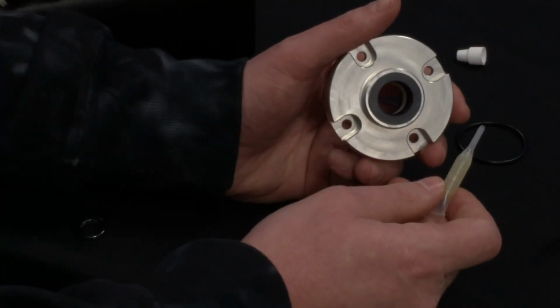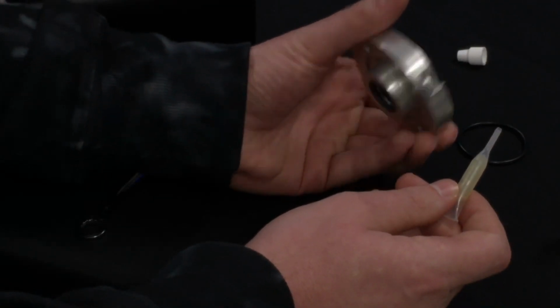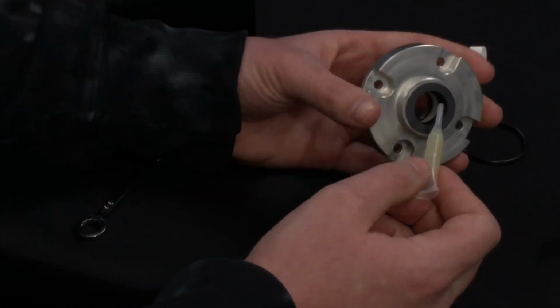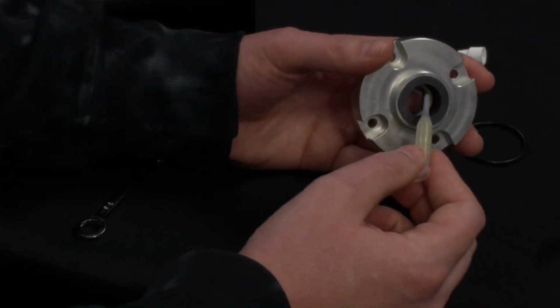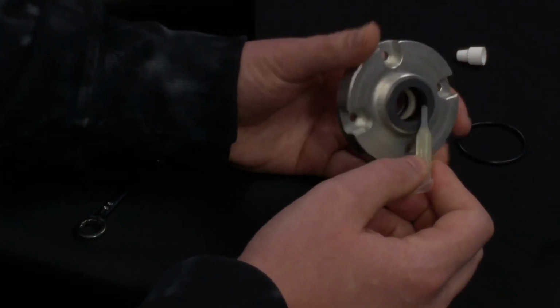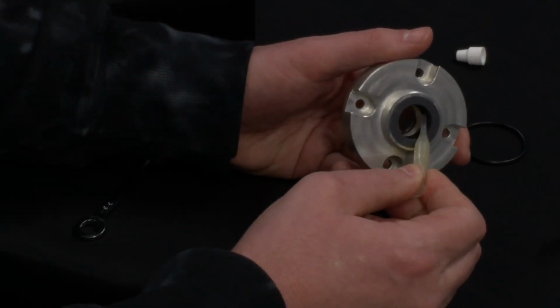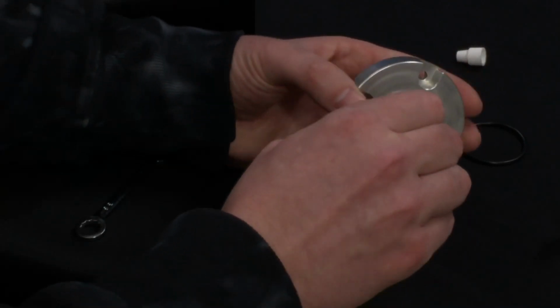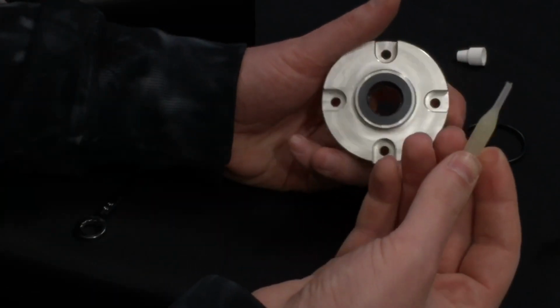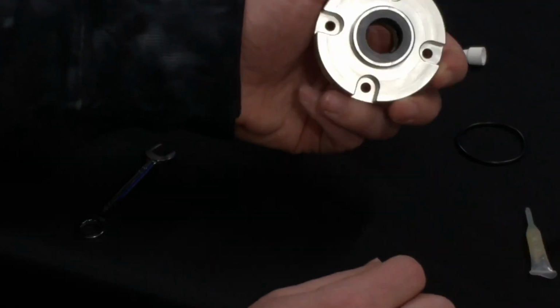The step I'll do first is prepare the new shaft seal assembly for install. And we'll start with applying the lubricant to the outer edge. And you may not need all of that, just a little bit is enough.